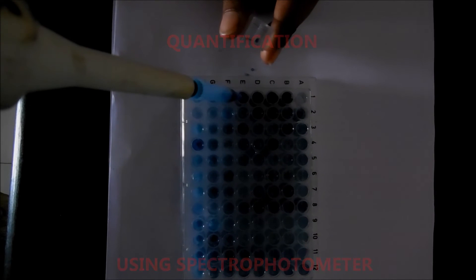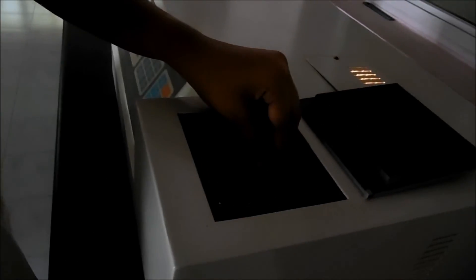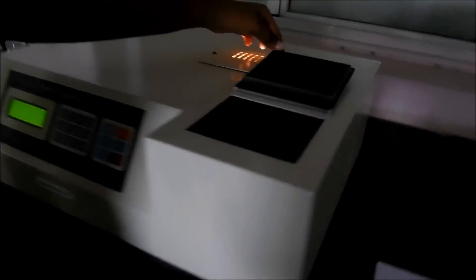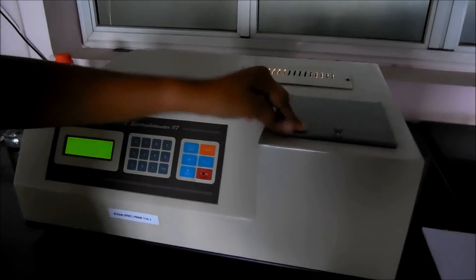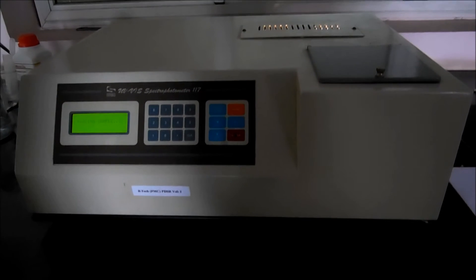For quantification, after one hour at room temperature, the free phosphorus content was quantified with a spectrophotometer at a wavelength of 650 nanometers. The amount of free phosphorus present in the sample was estimated by drawing a standard graph.